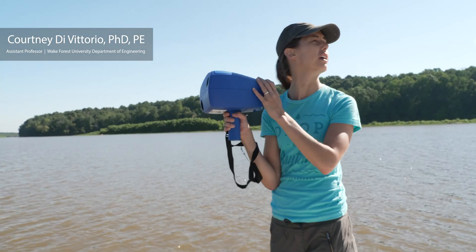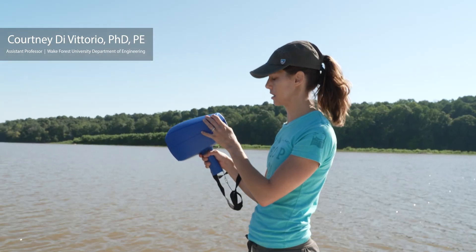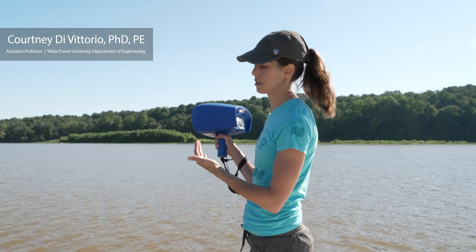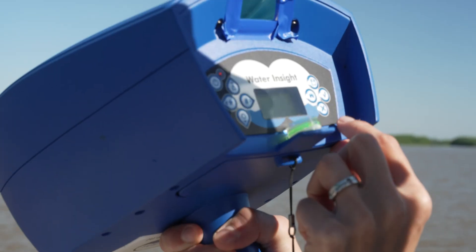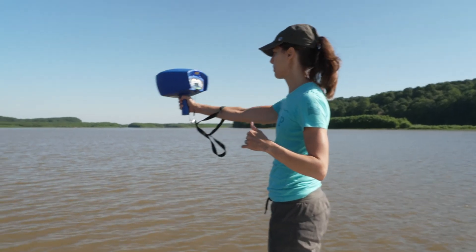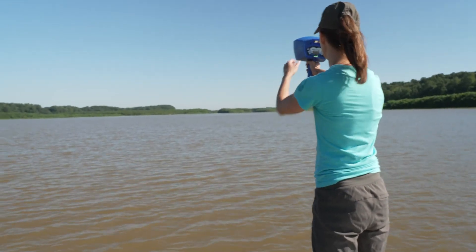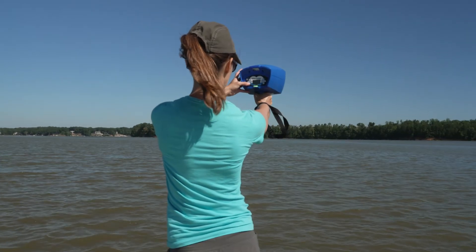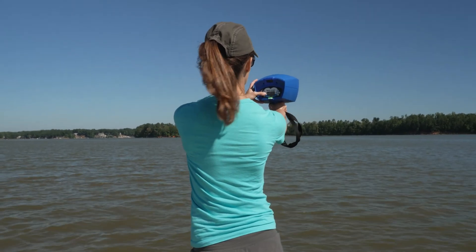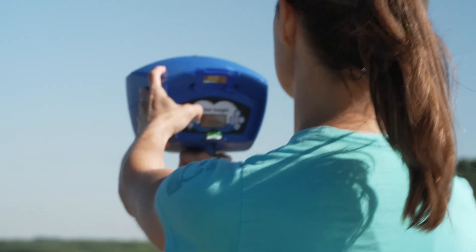What I'm holding is a radiometer, and what it does is it measures the reflectance coming out of the water surface. You line your back up to the sun, go out about 45 degrees, watch this level bubble here, and then you just hit measure and try to hold it steady.